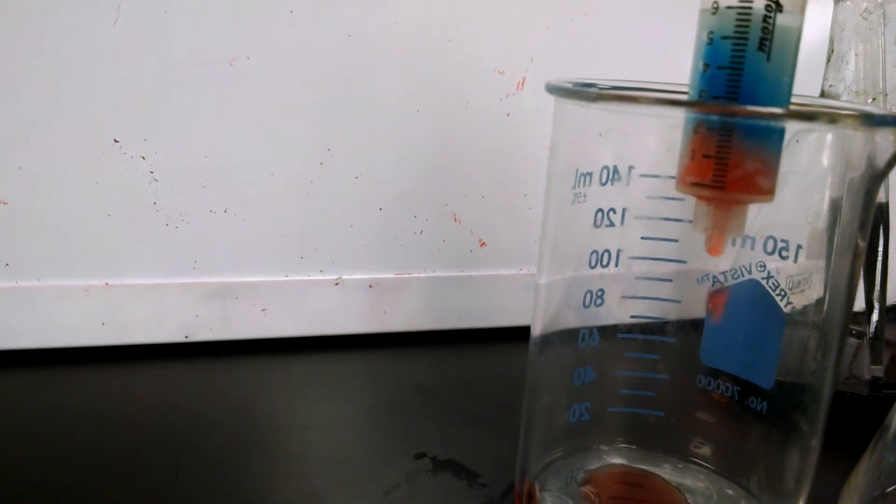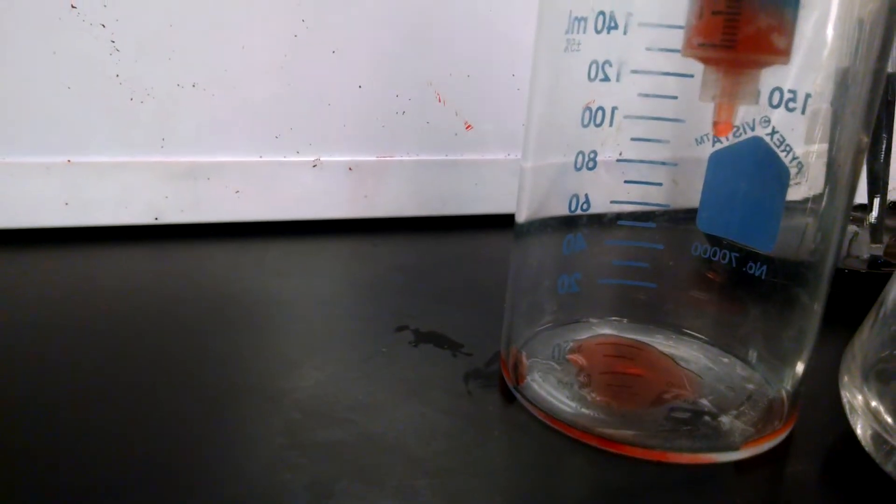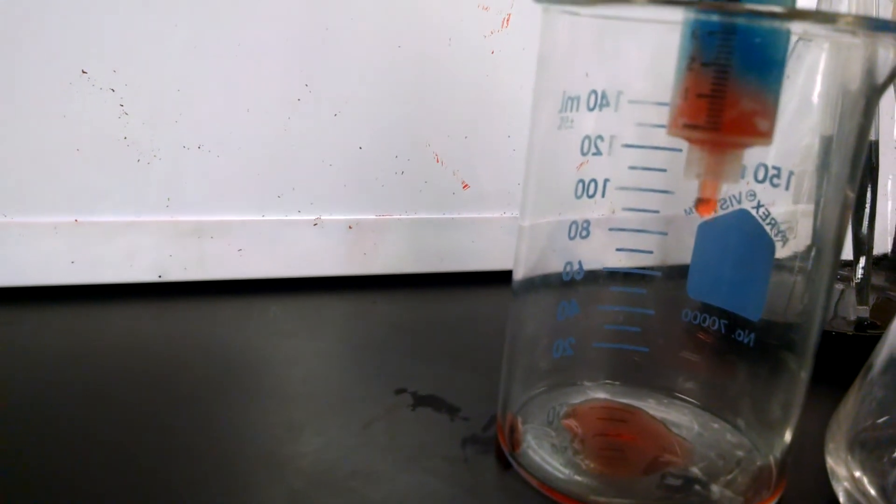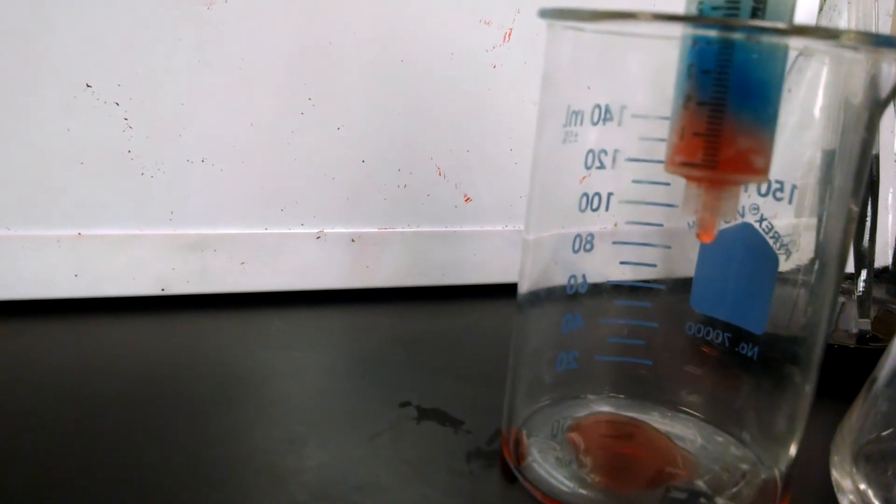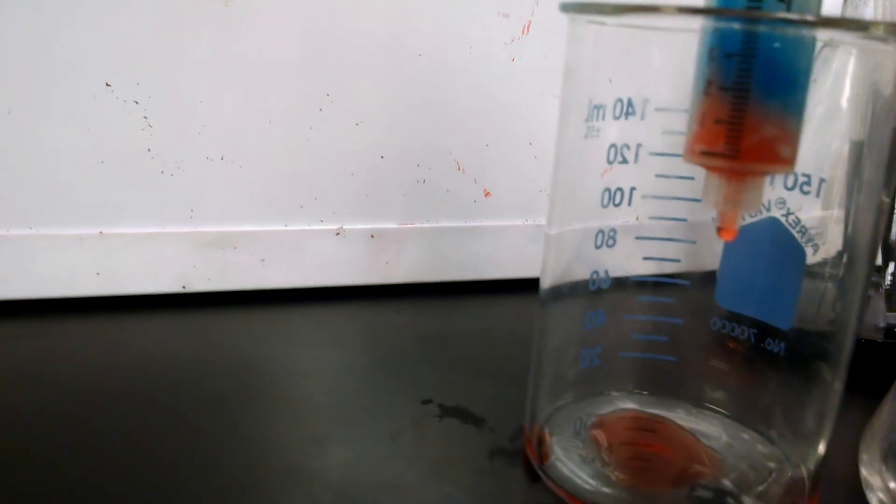I've resumed the video here so that you can get a look at the red color dripping out into the beaker as I put a little pressure on that. So we're collecting the red color off first with the 6% isopropanol or rubbing alcohol. I'll pause video again and complete the separation.